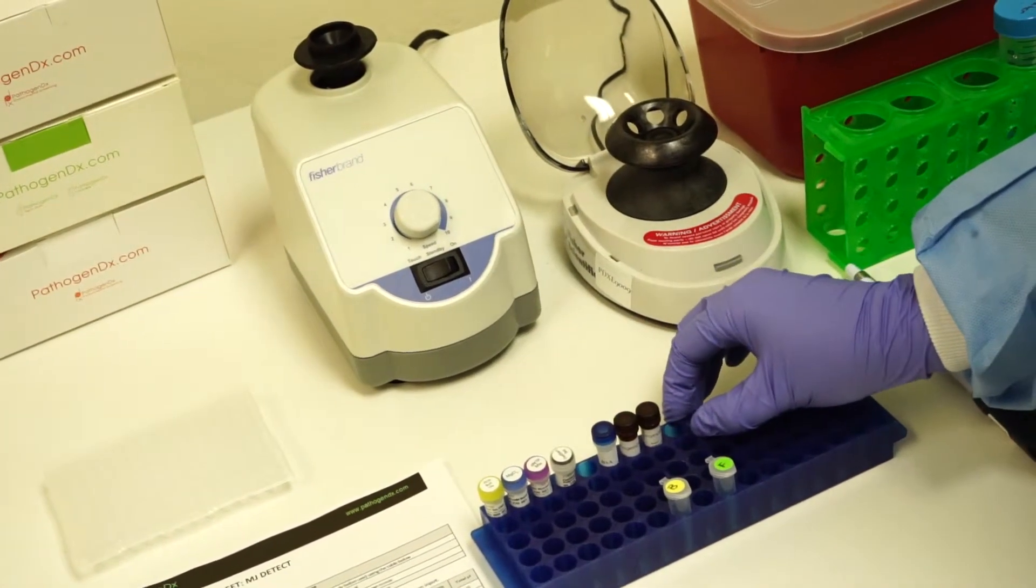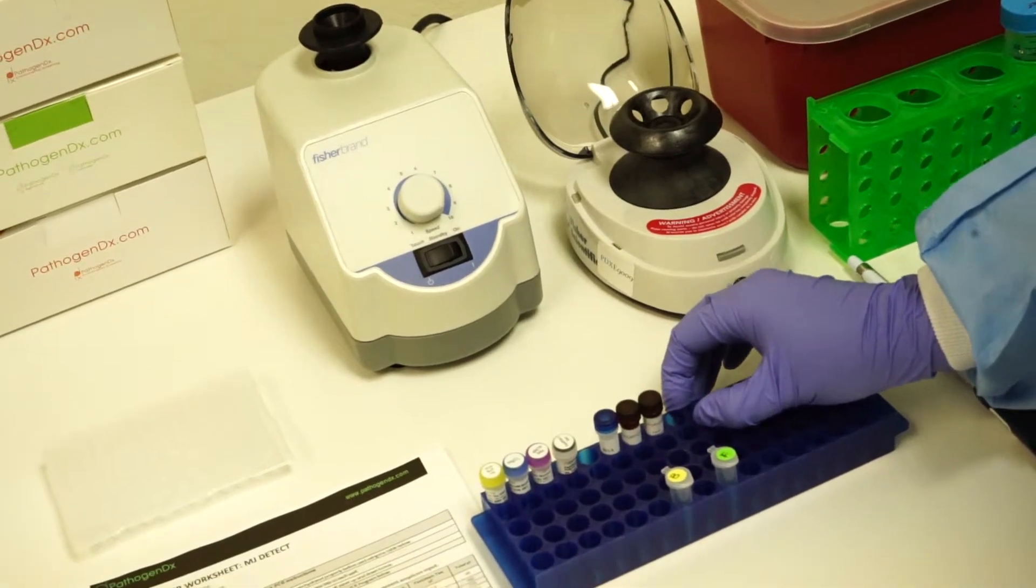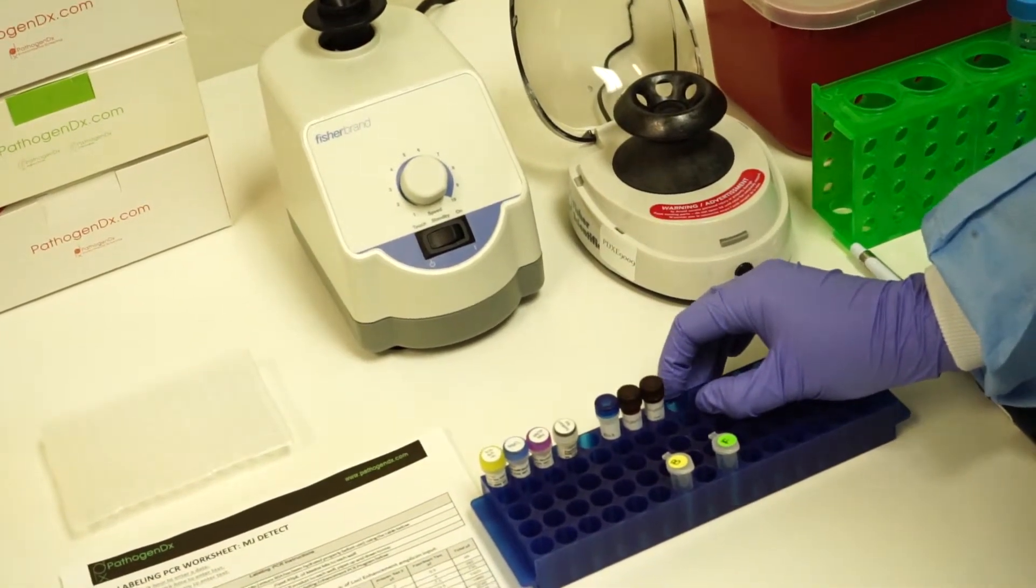Note that there is no longer any positive control added to the PCR mix, as this was added in the loci PCR and is not needed for the labeling reaction.